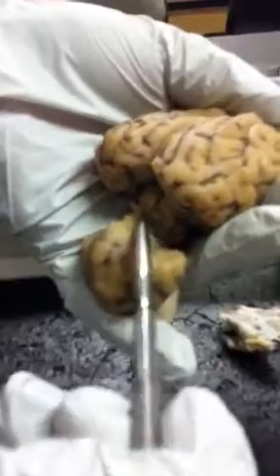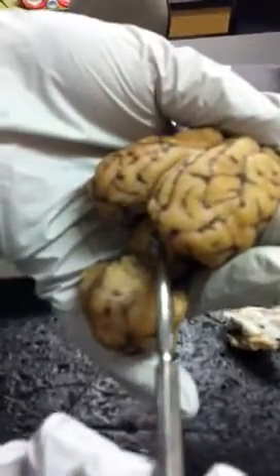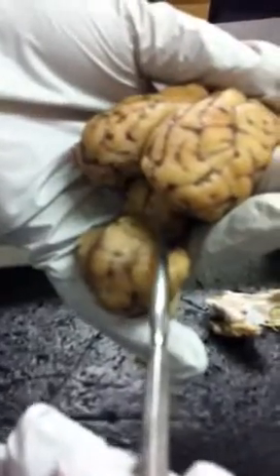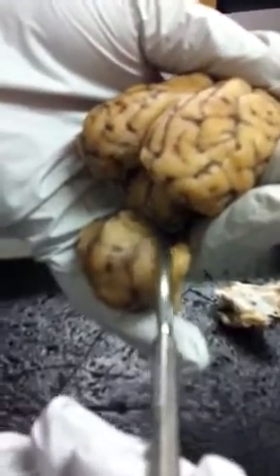Alright, so the superior colliculi are bigger relative to the inferior colliculi, and the reason is that because they're prey, and they need to see. They need a better sense of perception against predators.